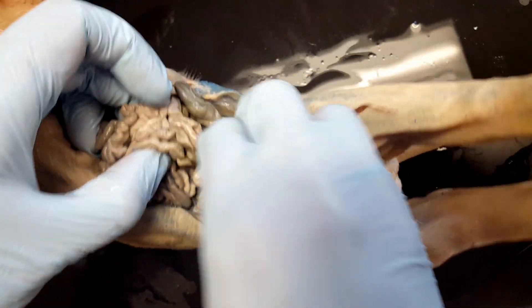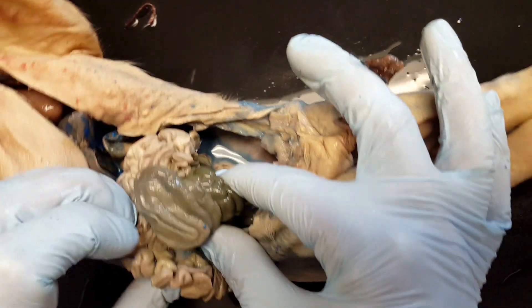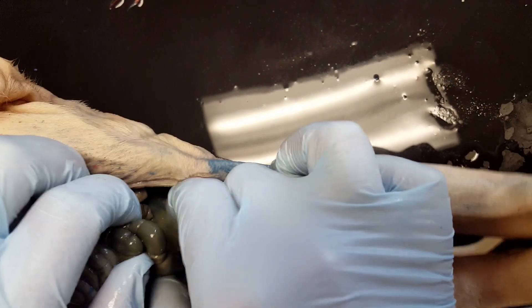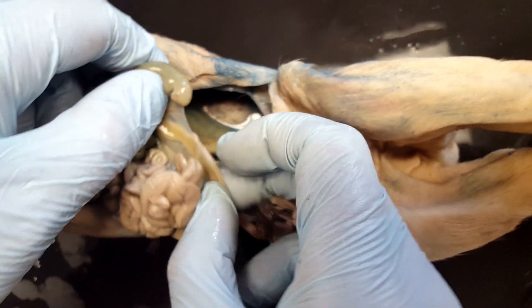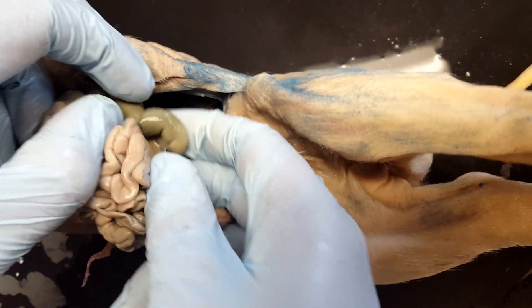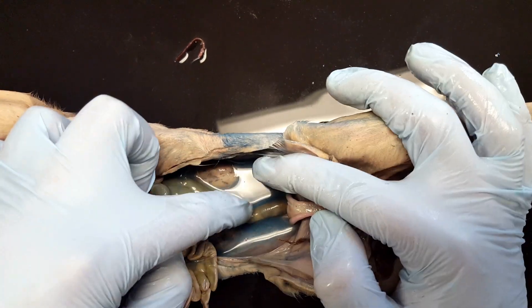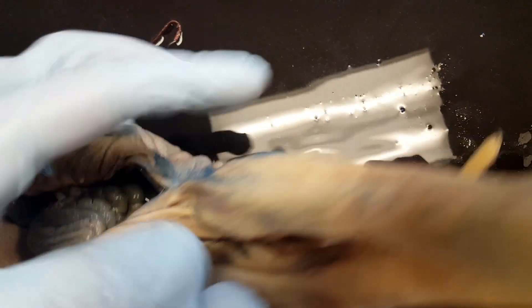If we follow the rest of the small intestines, we'll see the main part of the small intestines — the ileum. We can follow the small intestines all the way to where they meet the large intestines. In general, the large intestines are a lot greener than the small intestines. Right where small meets large, there's this pouch called the cecum. Make sure you'll be able to identify that. If we follow all the way, eventually it leads to the rectum, which we can see leading out to the anus at the back of the pig.